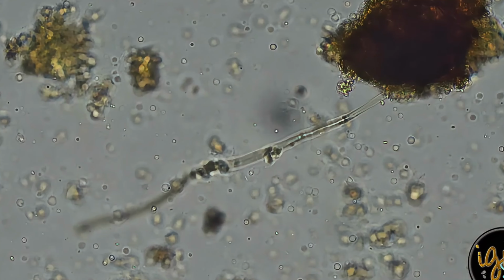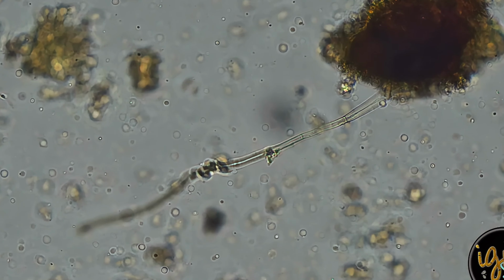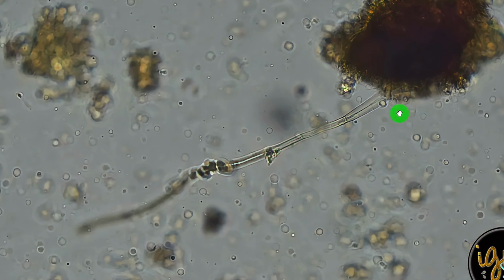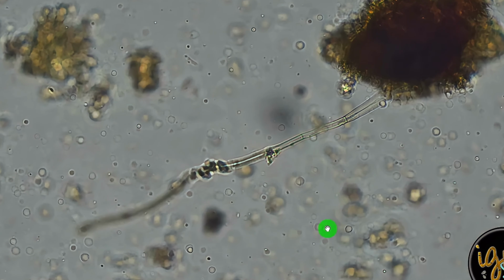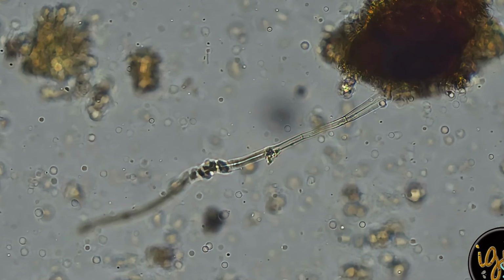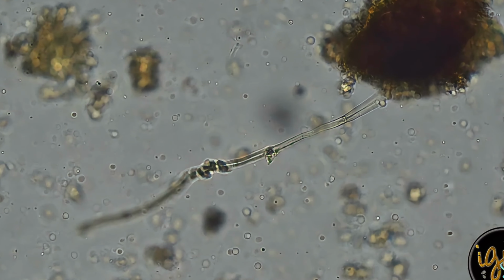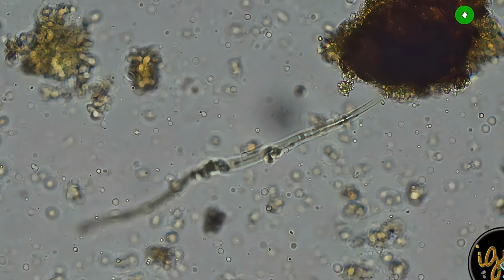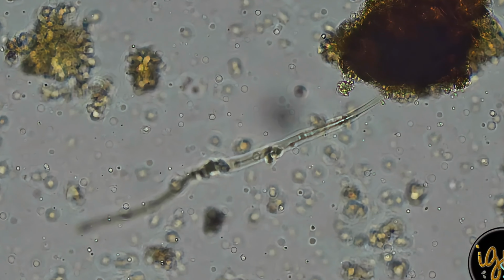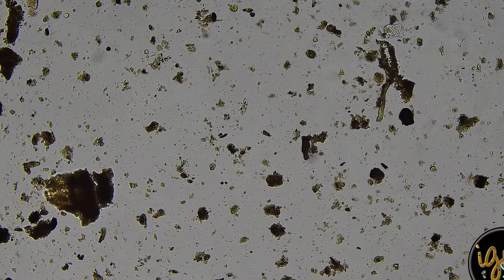This is fungal hyphae. And the reason I would call it that is that you can see they're called septa, these little separators here. There's one here, another one here. They separate their cells. And then you see how it attaches to this piece of organic matter here. And they connect from organic matter to organic matter, communicating and moving things around.